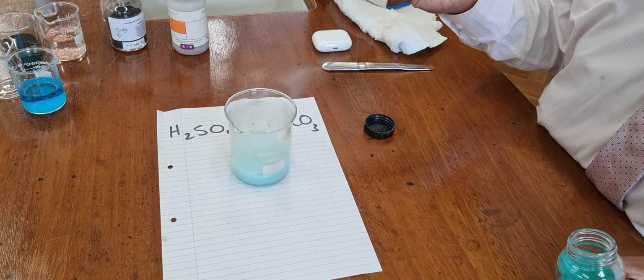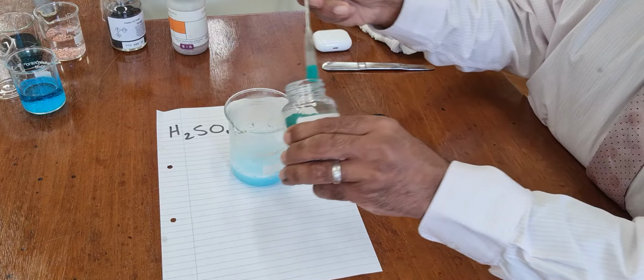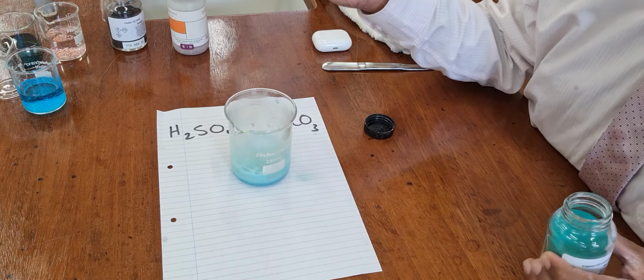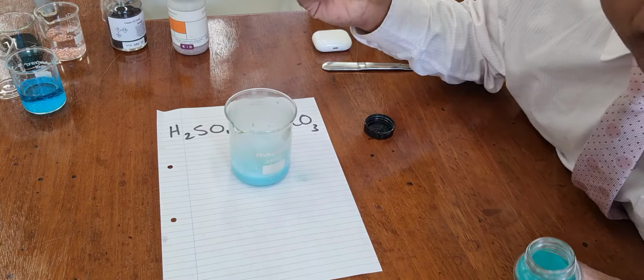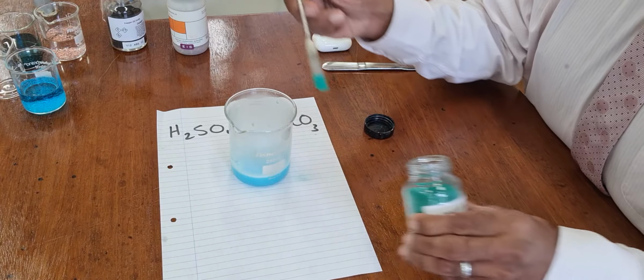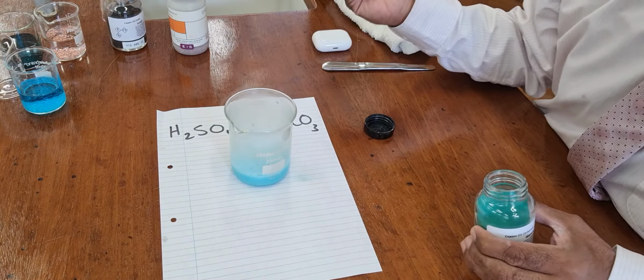See that, fizzy? You get reaction. More fizzy. Now you want to react all the acid away. Still some acid left.